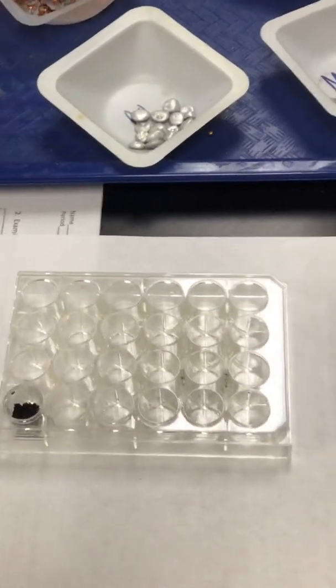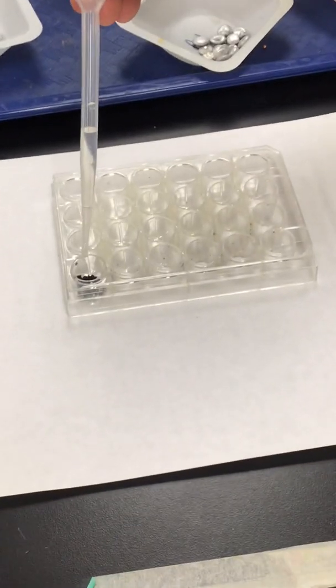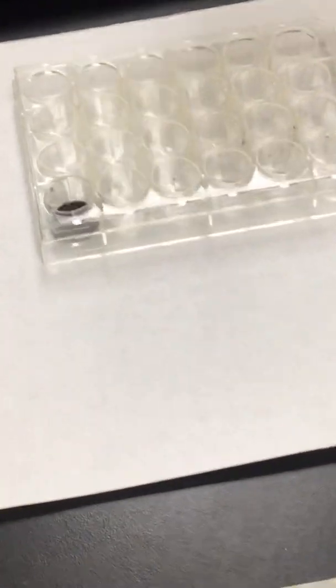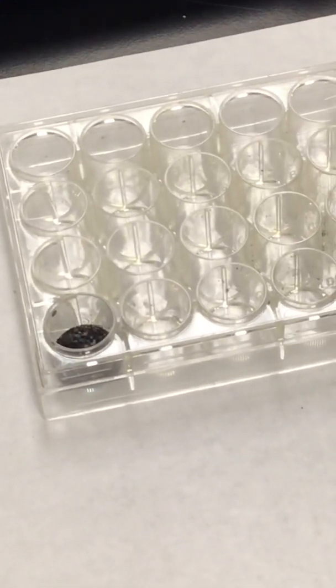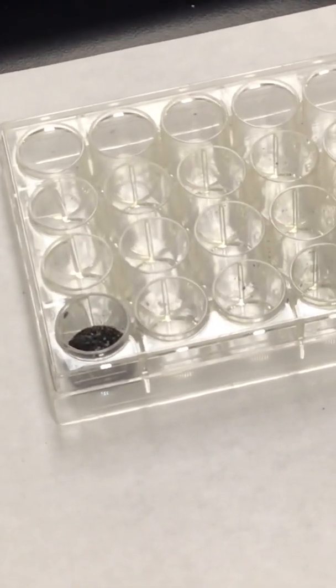I hate to say this, Ms. Castro, but I need your spot. There's less glare on the light over here. Are you ready? Okay, yeah. I'm going to put a couple of drops in here. Look for bubbles or heat, color change. Okay, no light produced.